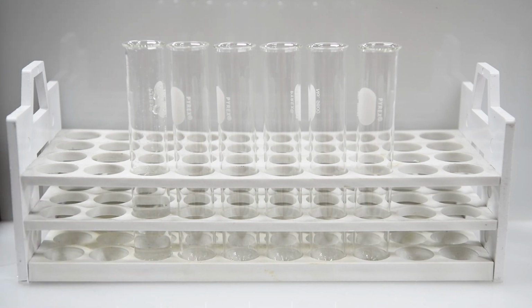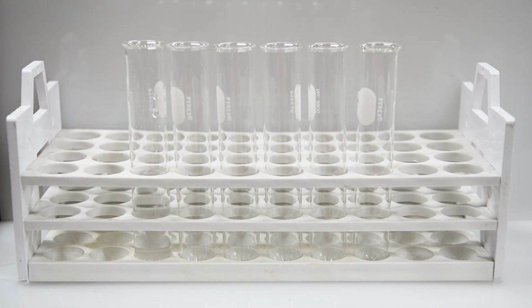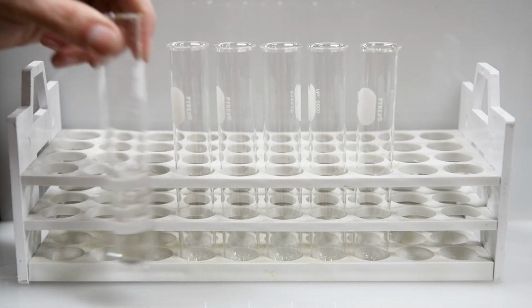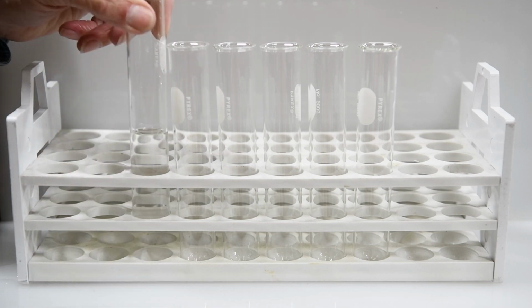Then we'll add a few drops of chlorine in the form of bleach. Bleach isn't really chlorine, but it contains chlorine, so we'll put a few drops of bleach in there. And to activate the bleach, to get it to release its chlorine, we're going to add 1 drop of hydrochloric acid. So now the chlorine is being released into the water. We can swirl that around. So far it doesn't look like anything is happening.